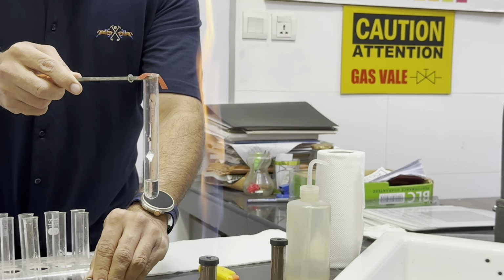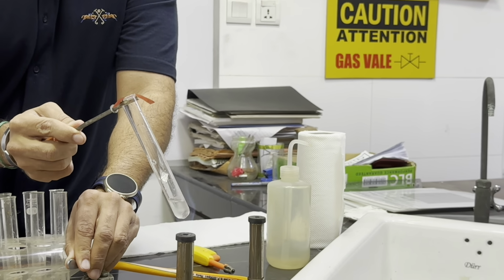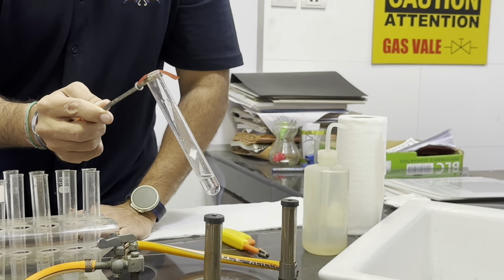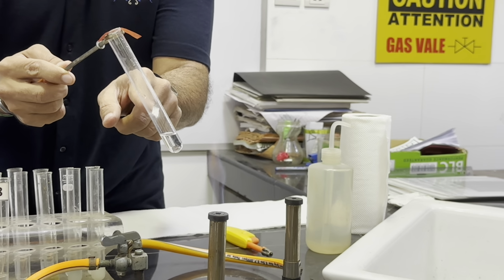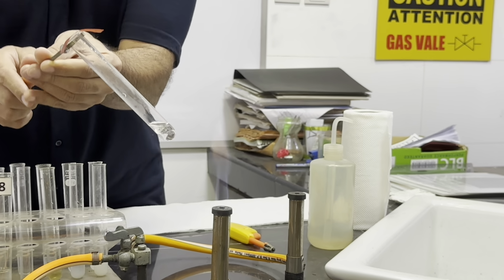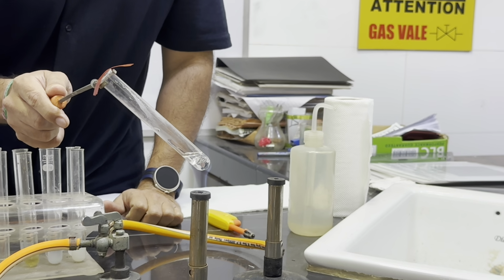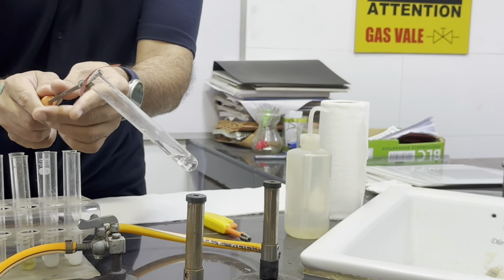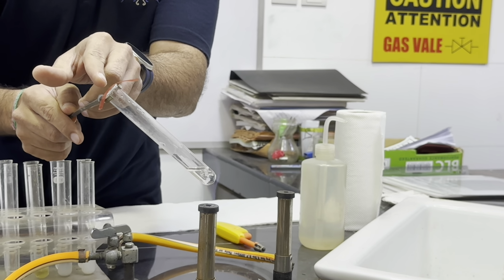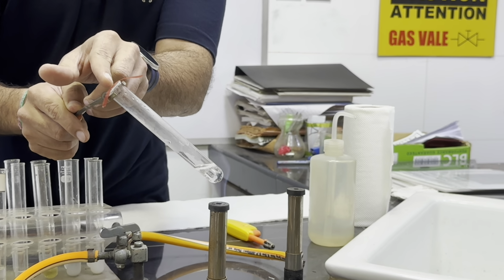What we will do is we will tilt this test tube a bit so that this paper will not catch fire. Now we can see the aluminum foil is on the wall, so we have to dip this first. Now it's inside, and now we will heat this solution. As soon as we see that there is a gas coming out, what will happen? The gas must turn this moist red litmus paper blue from the center, from where it is open to the test tube.